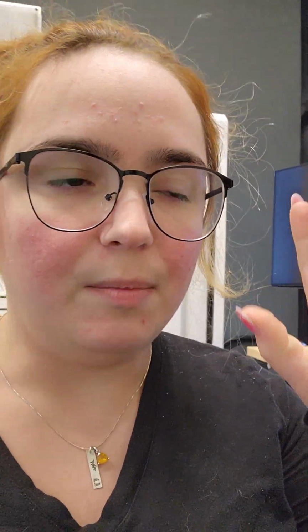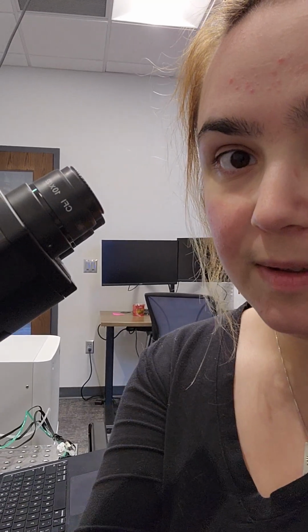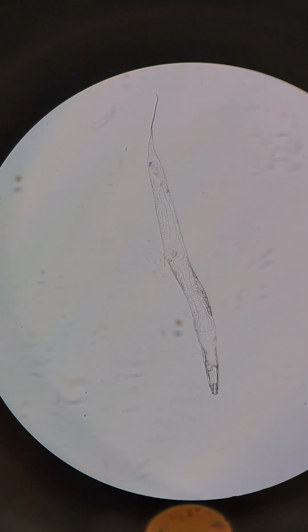Anyway, so I booted up the whole microscope. The software is open, and then I am going to figure out where it is just using the regular light path and not the lasers. So give me just 1 second, I'll do that. Okay, so I have it in here. I'm gonna flip it so that you can see. We've got our little worm in there.